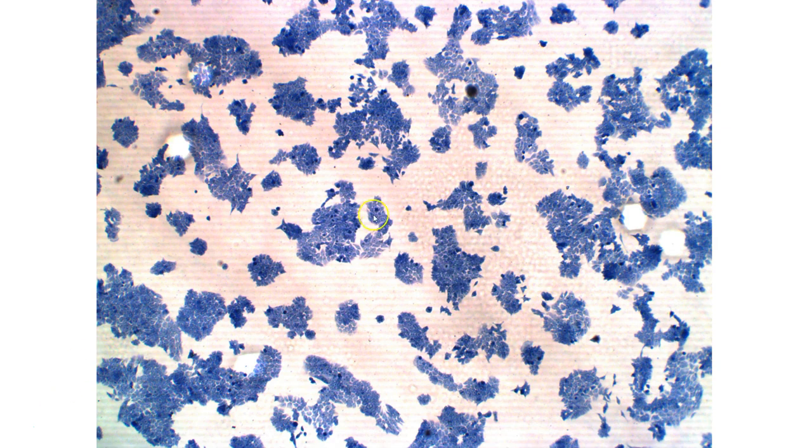So the cells on the plate are going to be flat. They will be attached to the surface at the bottom. There'll always be some floaters, and you may see them as these little unfocused blobs every now and then. But the majority of the cells should be attached to the culture when we are looking at them. So these are actual cells that are covering the surface area of the plate or the vessel that you're using to culture them in.